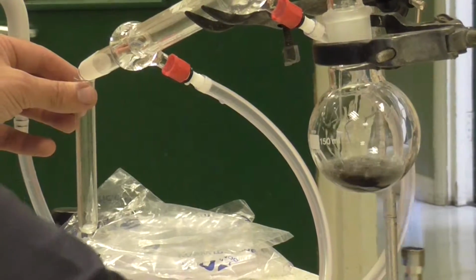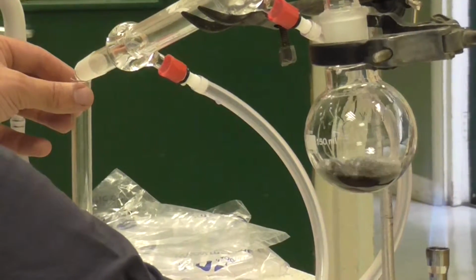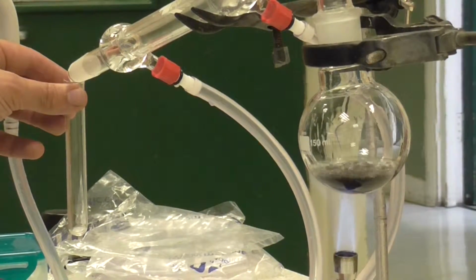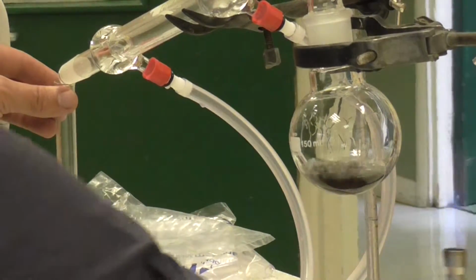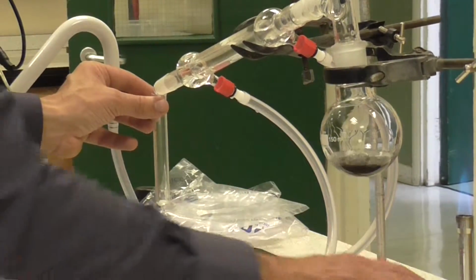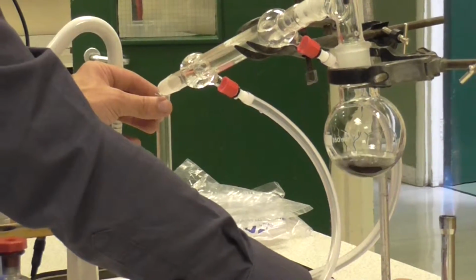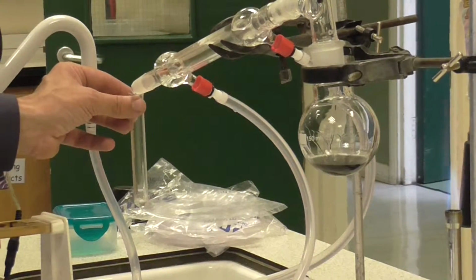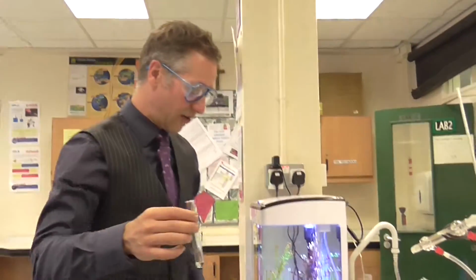Temperature's about 100, so it won't be pure petrol. It will contain some slightly longer hydrocarbons as well. So this will probably contain a little bit of naphtha, which is about C10 to C12. The darker materials are staying in the tube, and we've got some fuel dripping through now. So I'm going to leave that. I've managed to collect a small amount of short-chained hydrocarbons, so roughly this length, maybe a little bit longer, and that means they should catch fire quite easily.